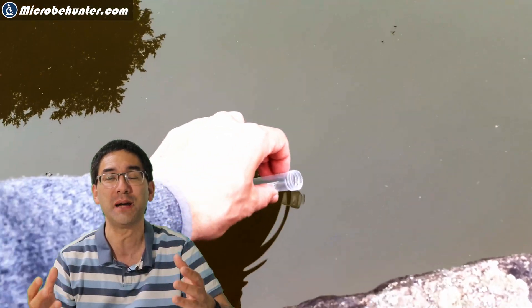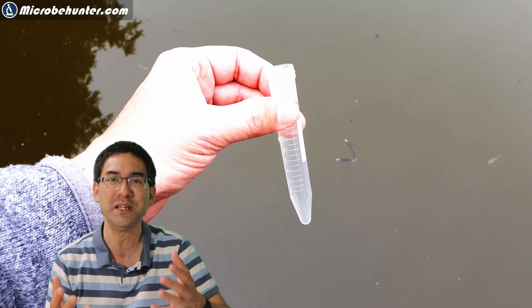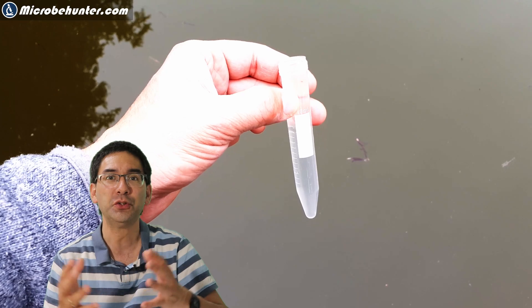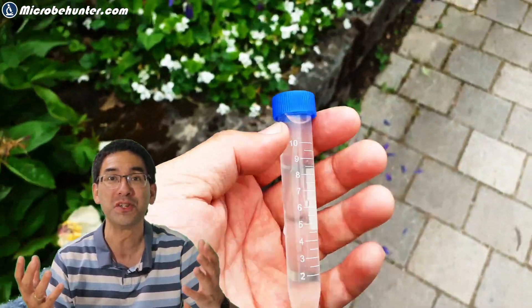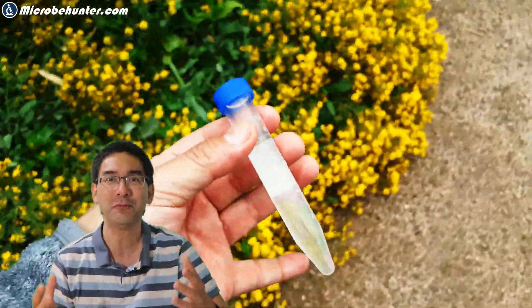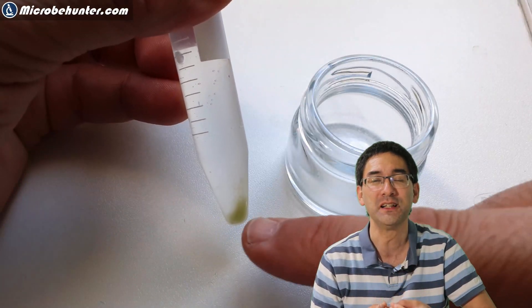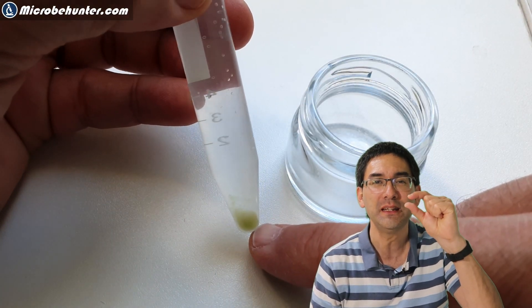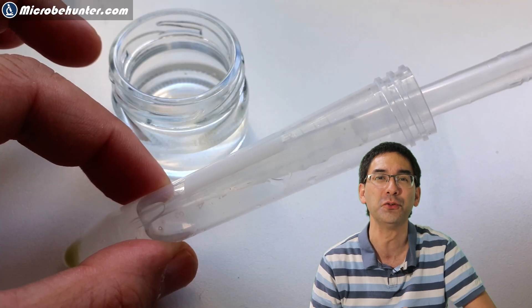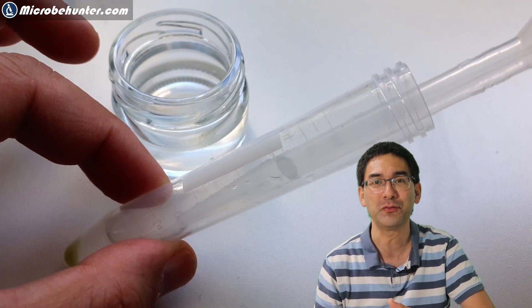I collected a water sample which looked relatively clear, despite the pond itself being quite green and murky. I took it home a little doubtful whether I'd be able to see something under my microscope, because normally you need a sufficiently high concentration of cells. But I let it stand overnight and luckily something deposited on the bottom of the tube — algae and bacteria — which were then put under the microscope.